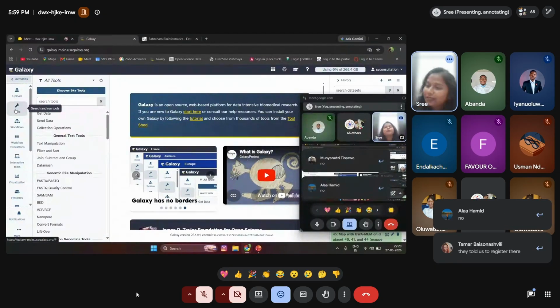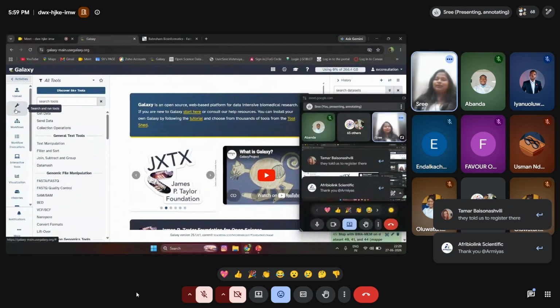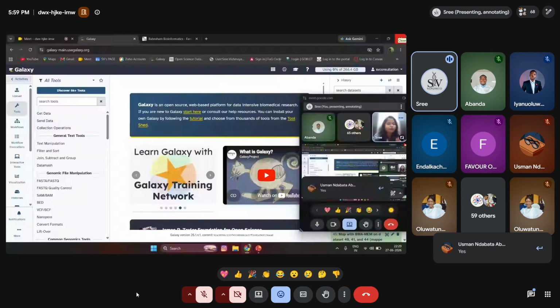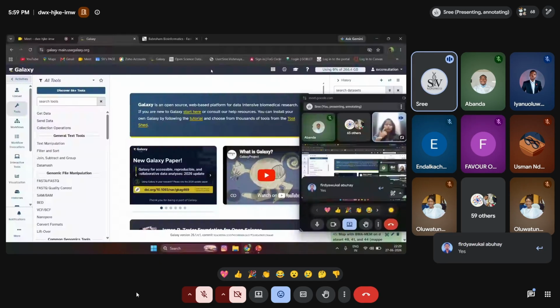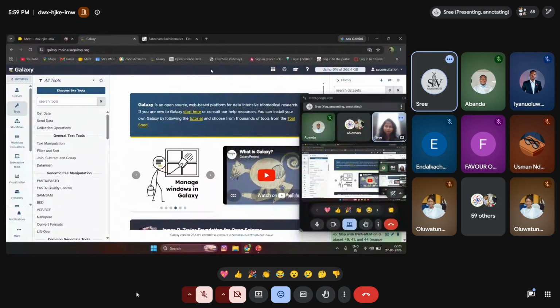Okay, fine. We'll explore this. This is the Galaxy site. It's built specifically for bioinformatics analysis. If any of you can share the link, or just search for Galaxy. You can see all the software tools related to bioinformatics presented over here.